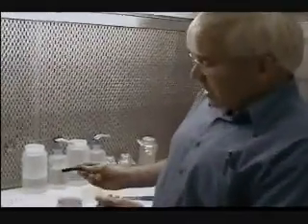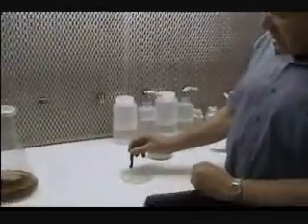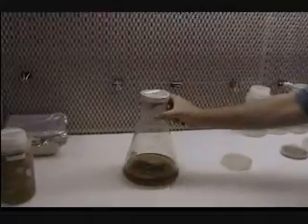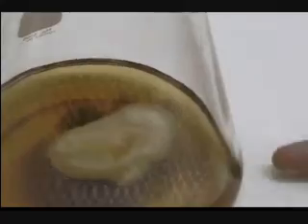We open these up and we have this cutting tool — sterilized again. We just take little cuts of the fungus and then scoop those cuts into here. This is the same nutrient media, only it's not gelled — there's no agar in it, but it's the same nutrient media that's in the petri plates. The culture grows out from the center, and one of these plugs will grow into that. Eventually this whole beaker will be full, and this is the basis of our inoculum.